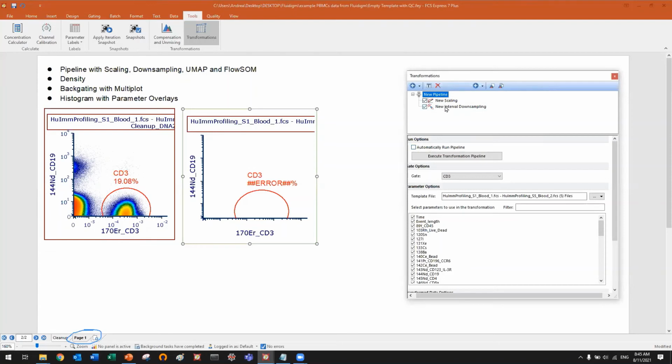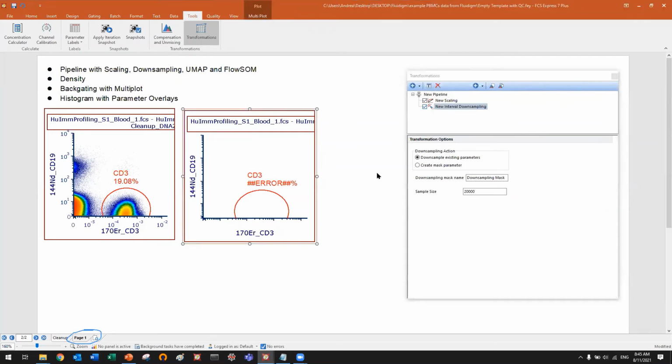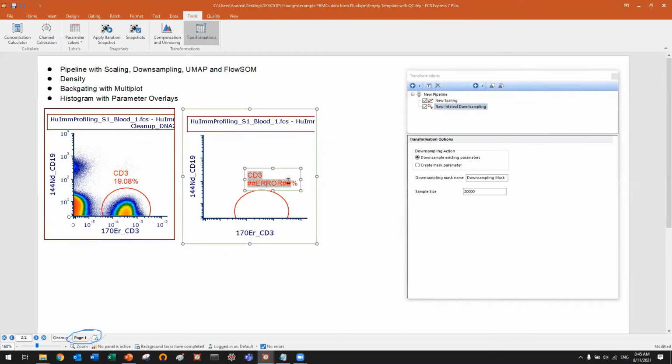As soon as I do any change, in this case introducing a new step, the plot gets blank to avoid you seeing non-updated data. So this is done intentionally. Also, this error means there is no statistic to calculate because this plot is now empty.